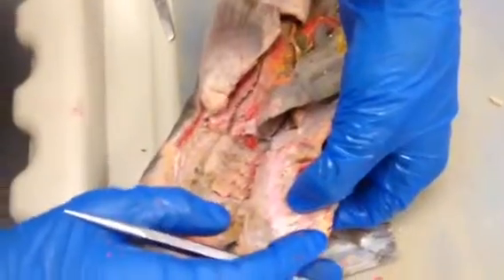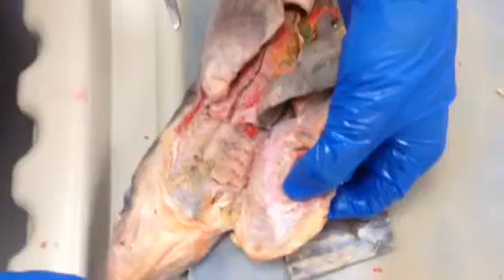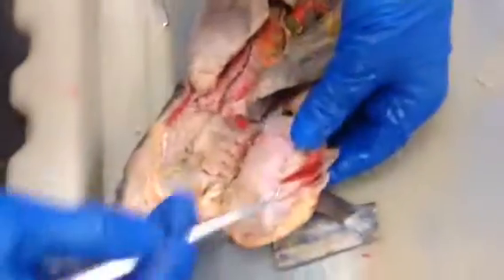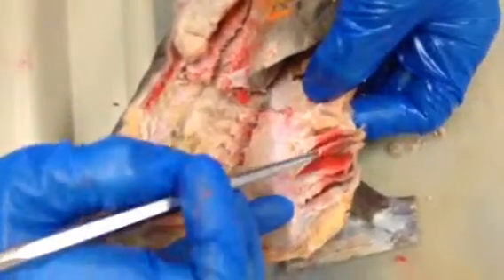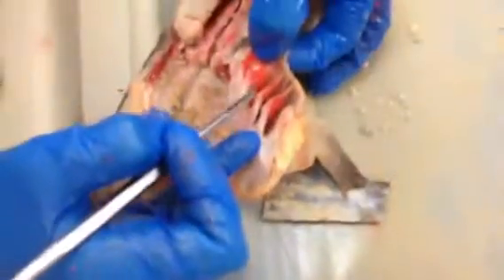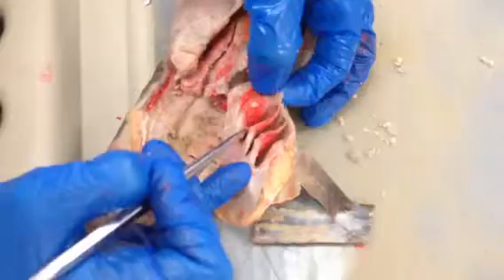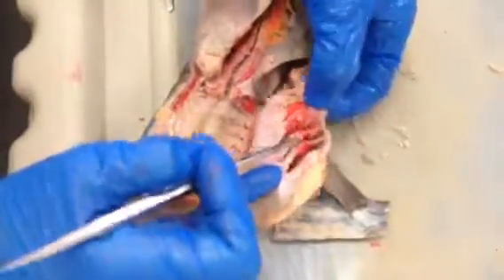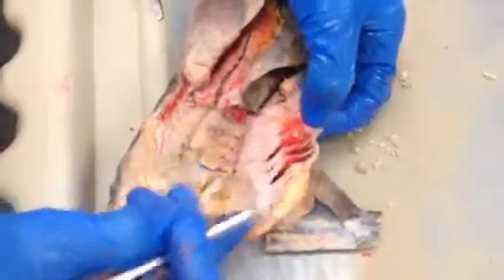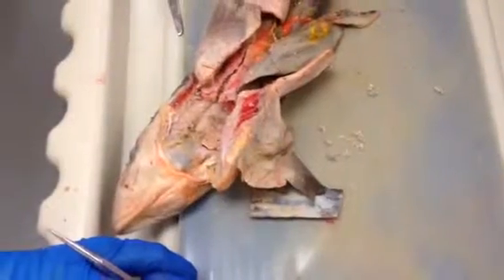I mean, we do it during the circulatory system. I'm not going to ask you arteries in this section, because we learned that and we look at it better in the circulatory system. So those are just right here. But that's just where they're cut, they actually go in a C here next to the ceratobranchial cartilage. All of that's afferent branchial artery. So this is all afferent branchial artery at the base of the gill lamellae. Like I said, we'll ask you those questions in the circulatory system. All right. Cool.